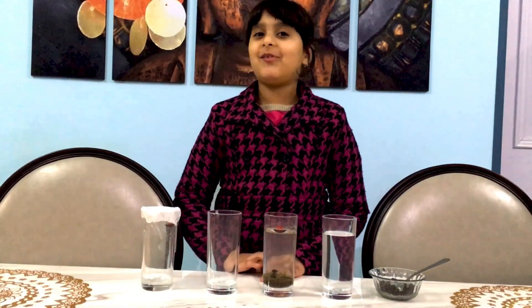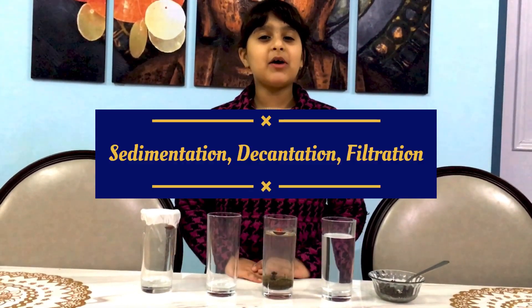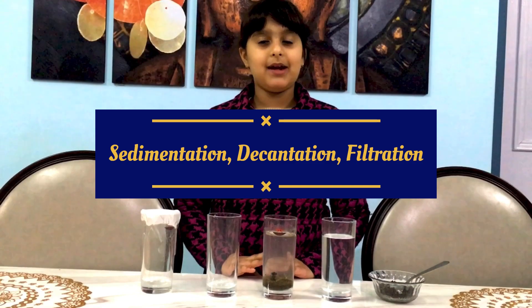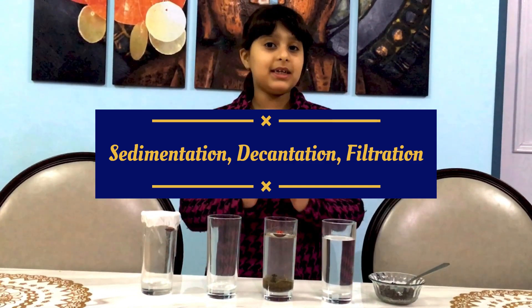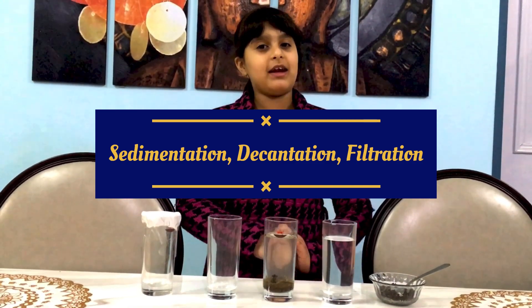Hello friends, I am Sia Kashal and today we are going to do a science experiment about sedimentation, decantation and filtration.